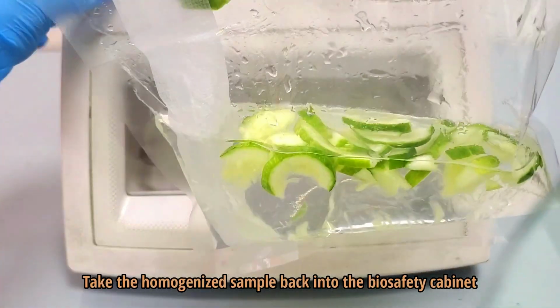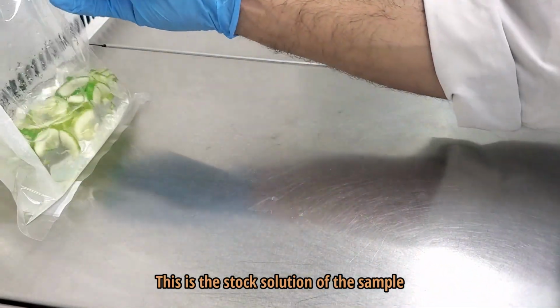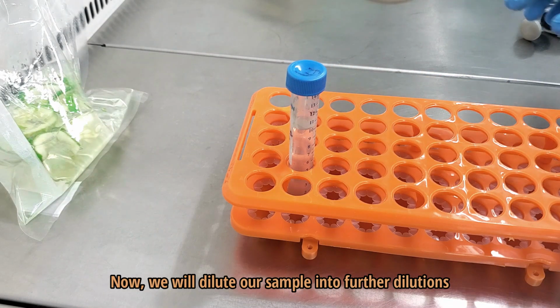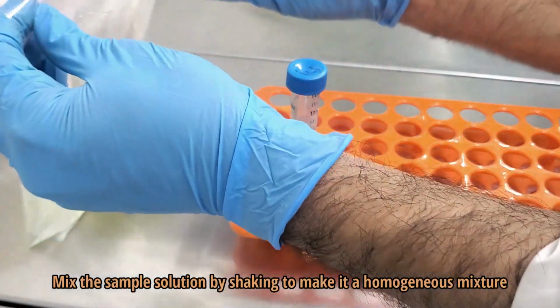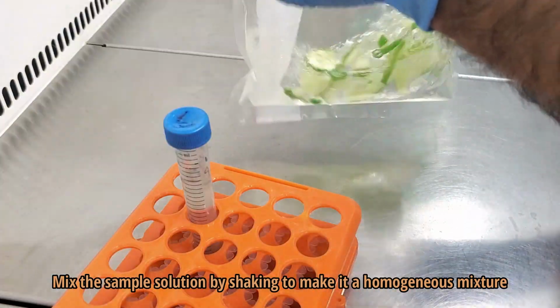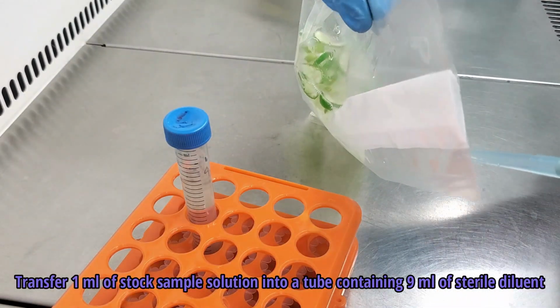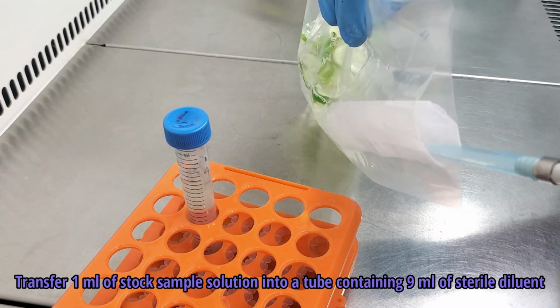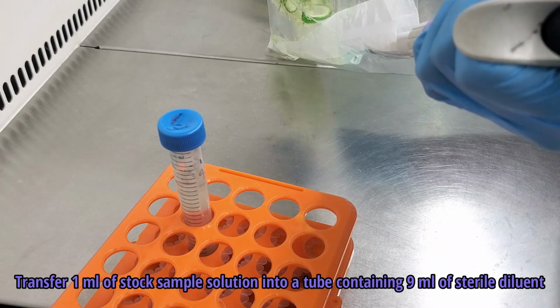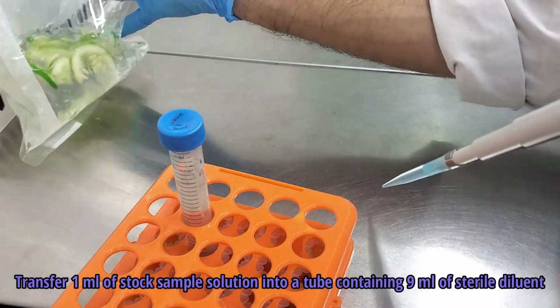Take the homogenized sample back into the biosafety cabinet. This is the stock solution of the sample. Now we will dilute our sample into further dilutions. Transfer 1 ml of stock sample solution aseptically into a tube containing 9 ml of sterile diluent.